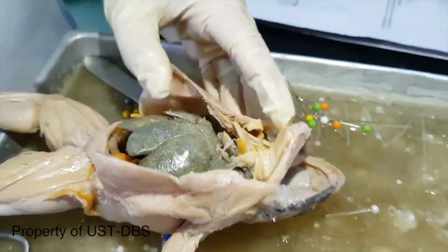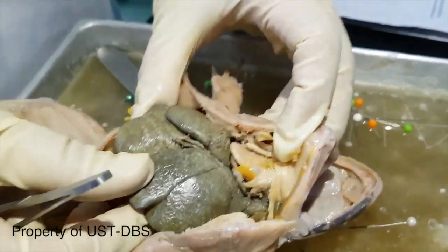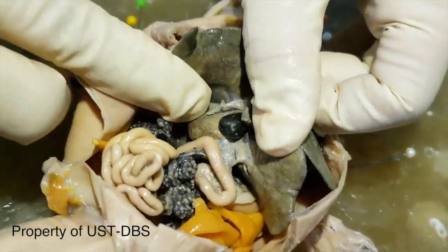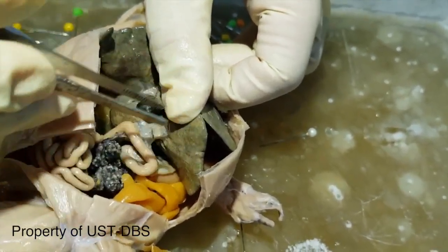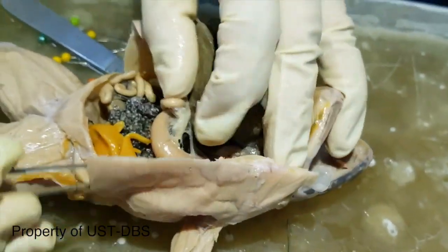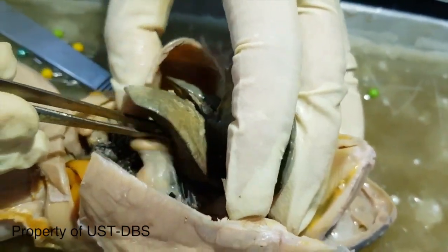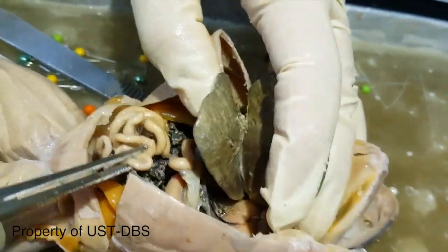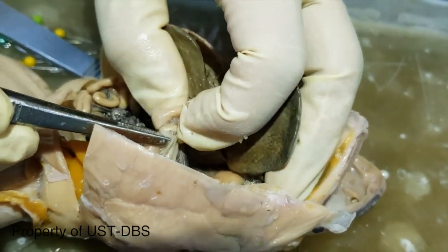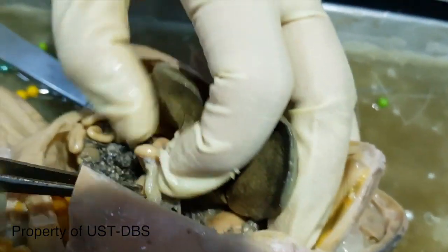So let's start with the digestive system. This big lobular structure here is the liver, and this one here is the gallbladder. The gallbladder, the liver, and this is the stomach. Then it tapers towards the end to the coiled small intestine. The part of the stomach that goes towards the small intestine is the duodenum. Then it goes to the small intestine.